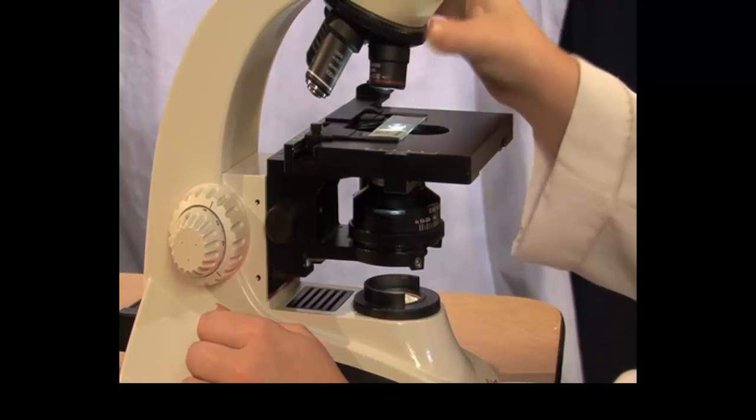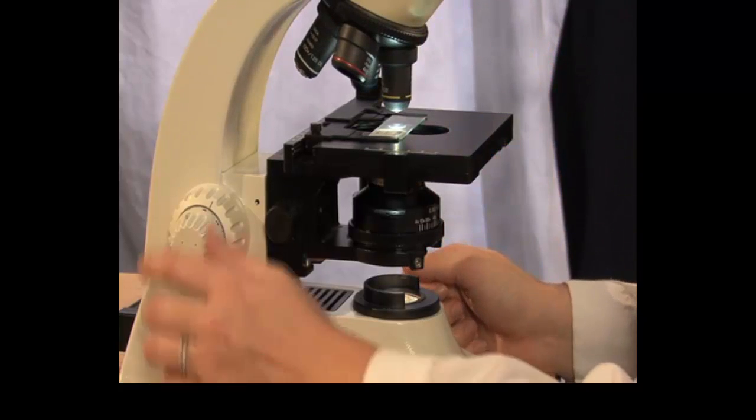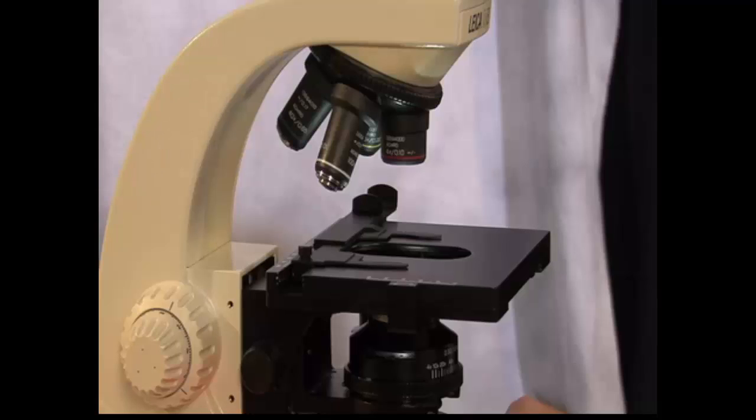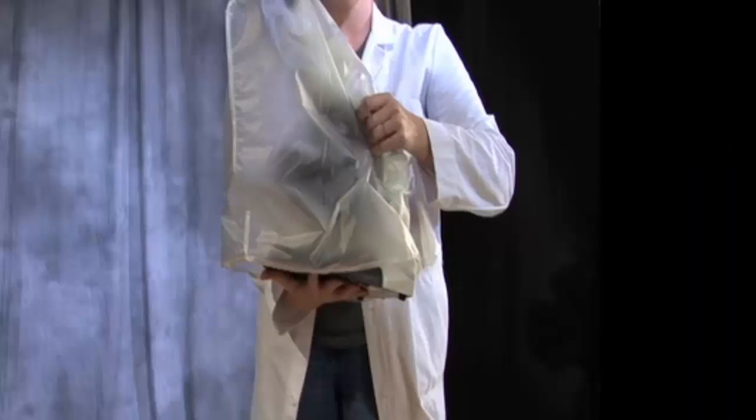In this video, we are going to show you how to use the light microscope to focus on a specimen and how to prepare your microscope for storage once you have finished observing the required specimens.